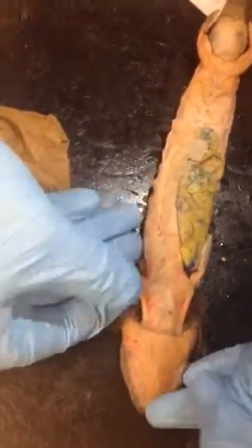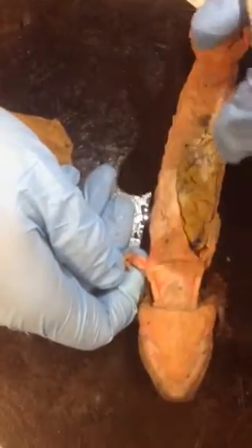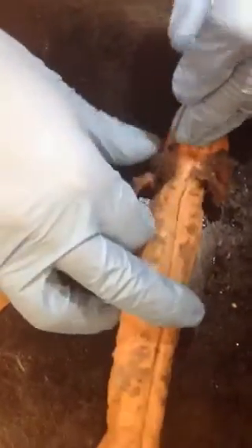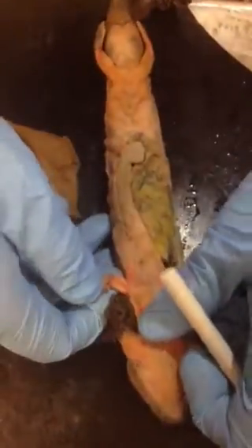Now, the ones of the arms are some of the toughest to know. And the way I usually remember them is that there is one that's super easy. That is the triceps brachii. It's the big one you can see dorsally. That one. Now, on the other side, you will see two of them.